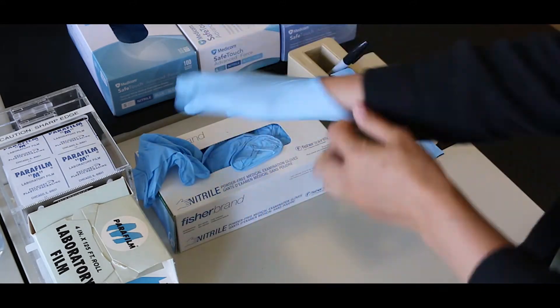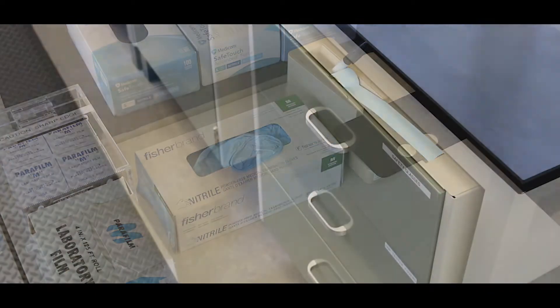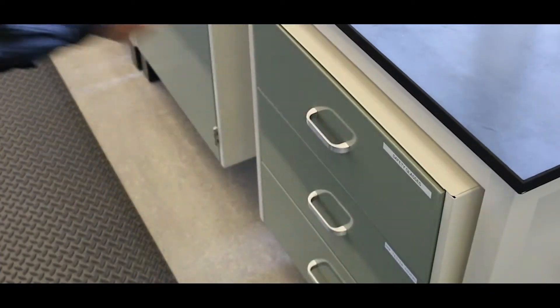It is also important to review the safety data sheets for the reagents that are used and to use any personal protective equipment that is recommended.